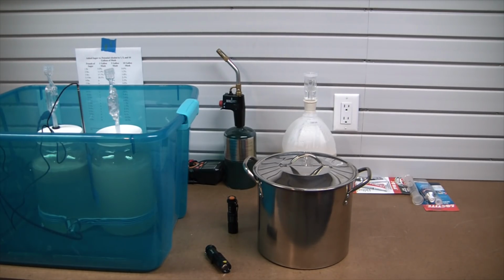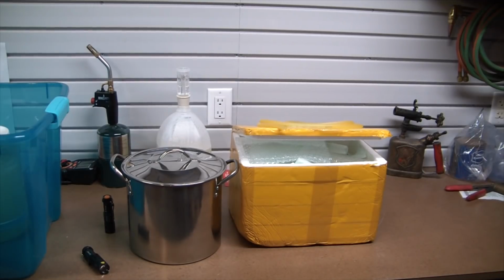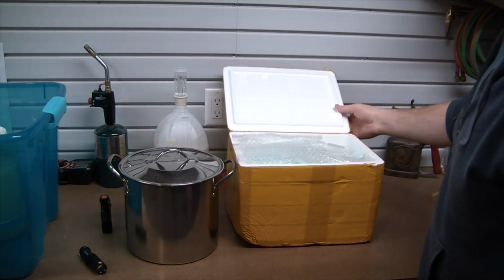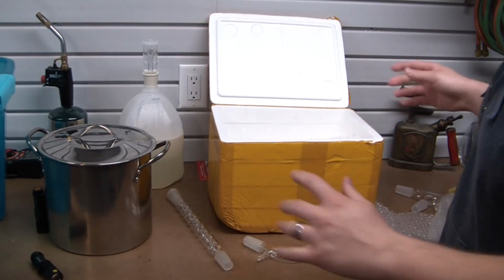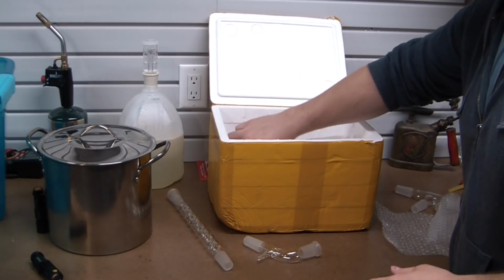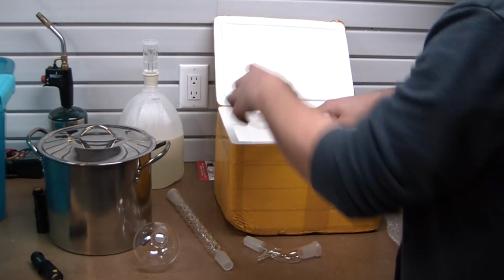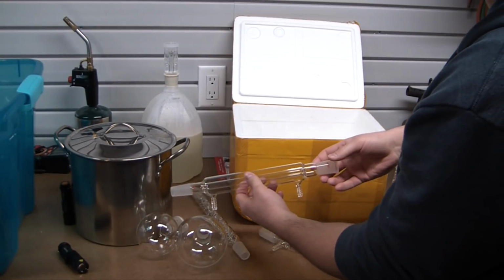And the beautiful thing, or terrifying thing, depending on how you look at it, is I got this super cheap distillation set off eBay. Now, that alone should tell you to be wary. Yes, I'm a bit nervous about using this. The crazy and terrifying thing is, this entire distillation set on eBay cost me something like, I think it was $33.